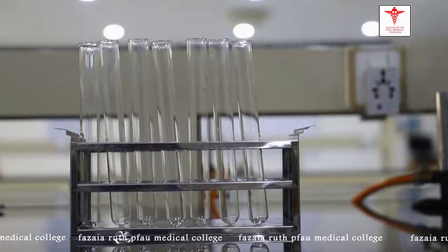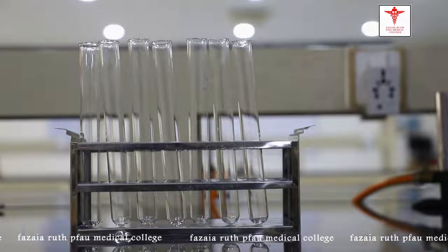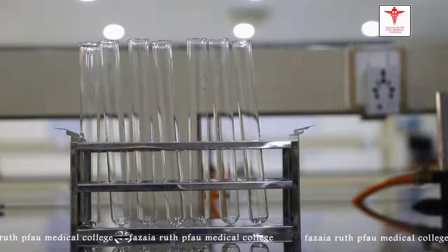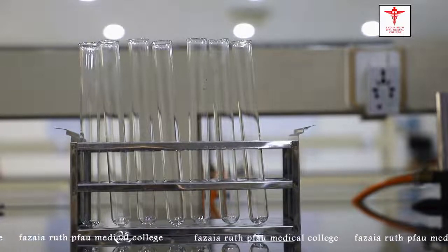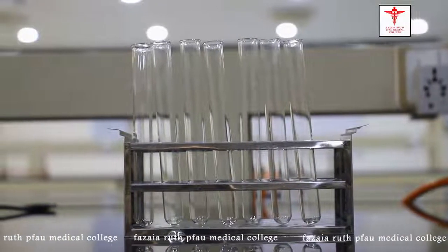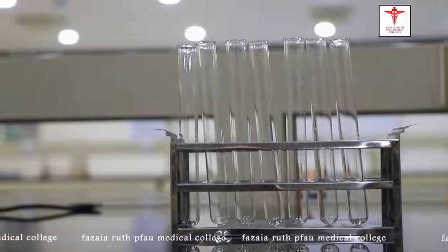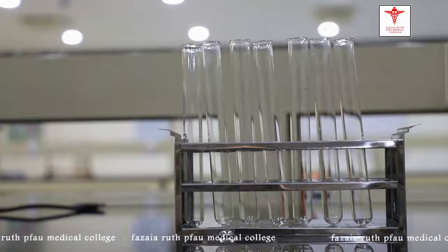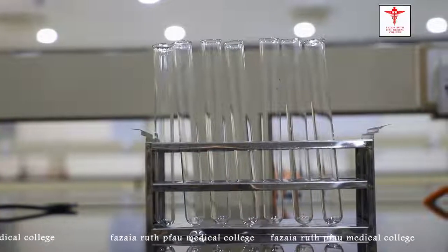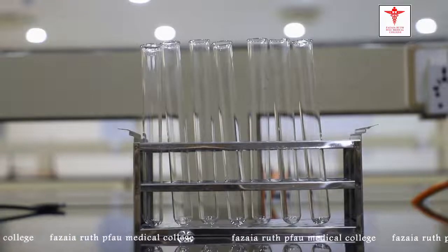Now we are going to perform those practicals. First we will do the general tests for the detection of proteins. I am Dr. Maha and with me is Sir Shiras who is going to perform the tests. The general tests for detection of proteins are: Biuret test, lead acetate test, and sulfosalicylic acid test.